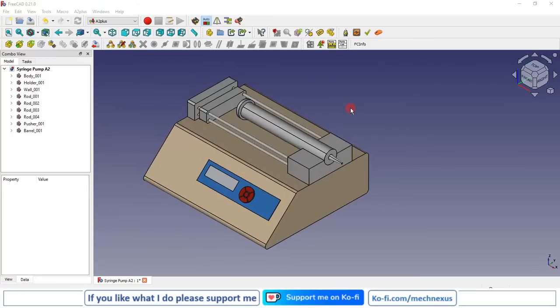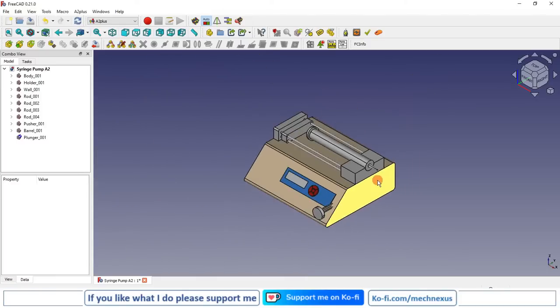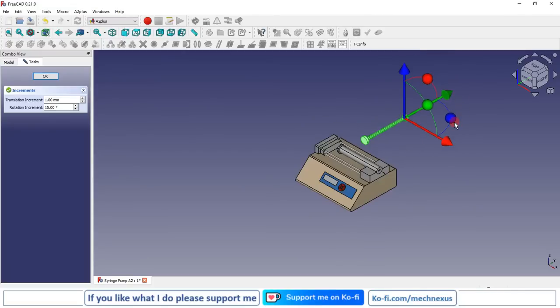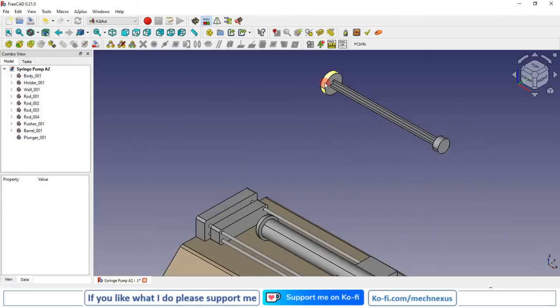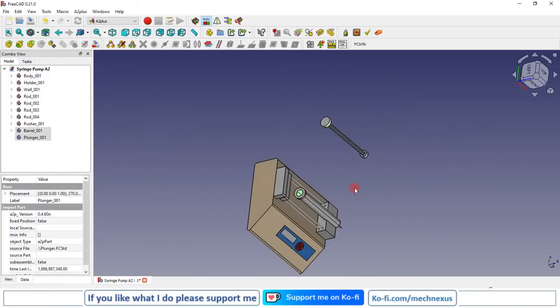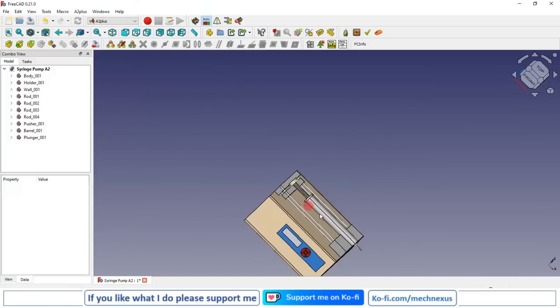Next part which we are going to assemble is a plunger. I will select add part and select the plunger. Now I will select my plunger, click on the transform tool and I will rotate it as per my orientation and I will accept it. Now I will make the concentric relation with this and inside face, accept it. Now I will give the distance constraint.